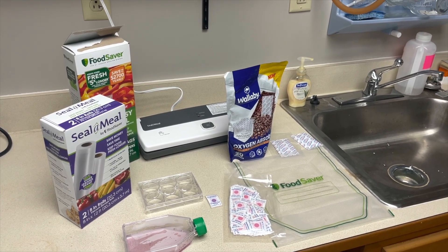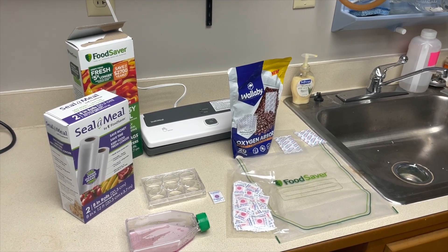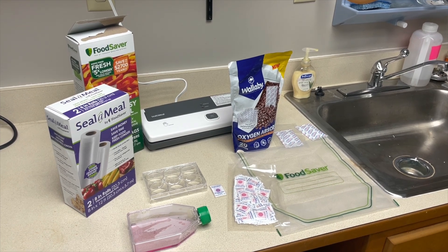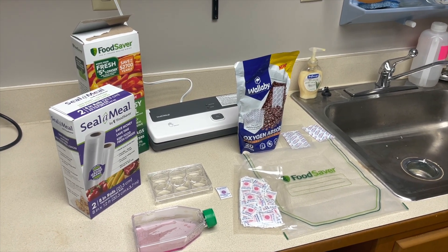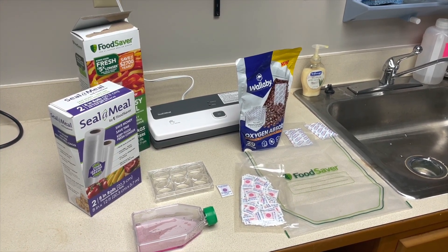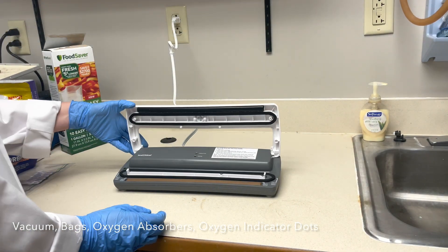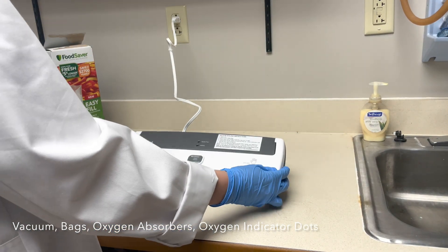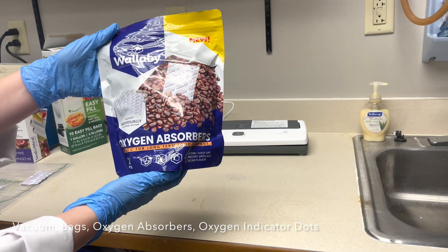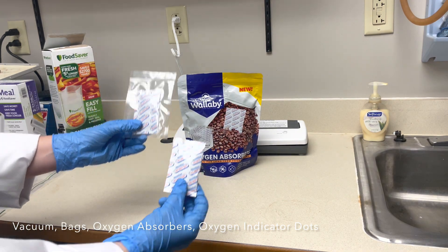The vacuum packer method is easy and low cost. This method is good for those doing research without access to a standard hypoxia chamber. Most of these materials are easy to obtain. The materials used here were standard store-bought vacuum packer essentials. As you prepare to create hypoxia for your cells, gather all your materials. This is the vacuum packer — familiarize yourself with how it works and where to insert the materials. These are the oxygen absorbers; they come individually packed and are filled with iron powder to help absorb excess oxygen. For each plate we pack, we use two oxygen absorbers.